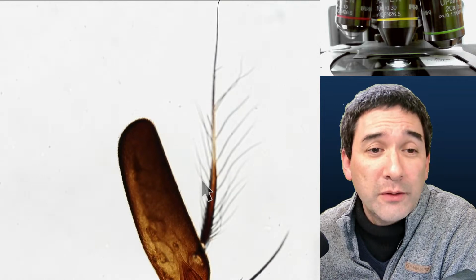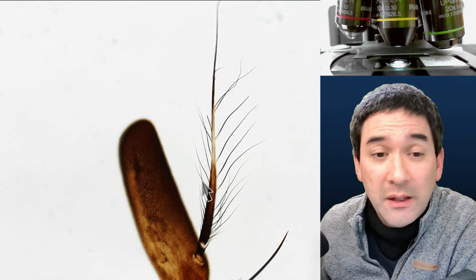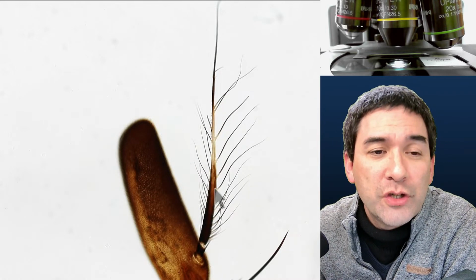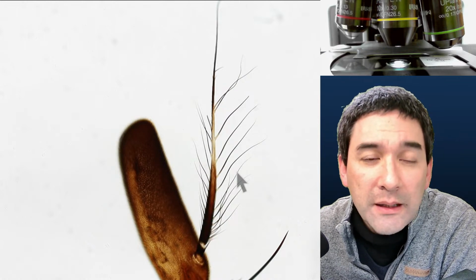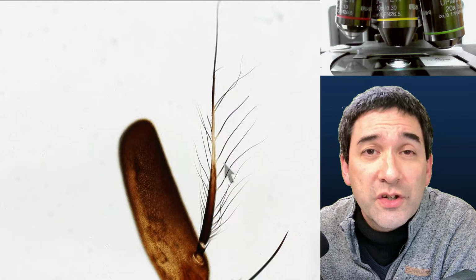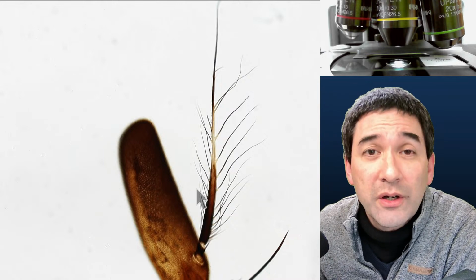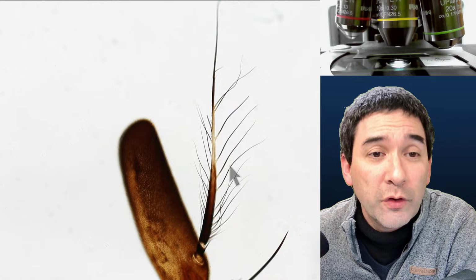I cannot talk about flies so much, but especially some insects, also moths for example, have extremely large branched antennae, and they are used for picking up chemicals, and also so-called pheromones. These are chemicals produced by the insects for mating, so they're able to smell each other sometimes over long distances.